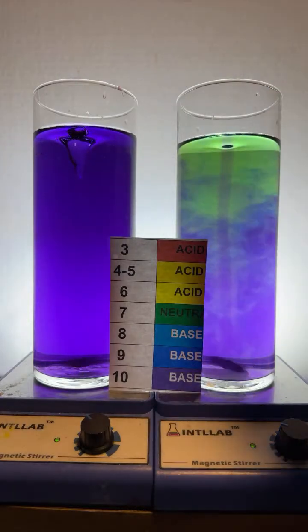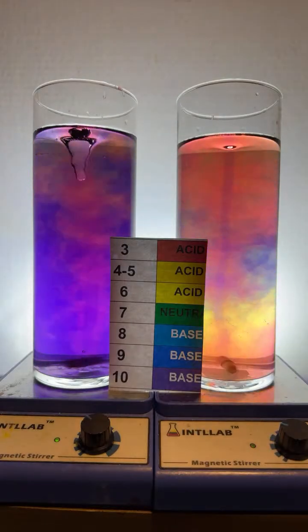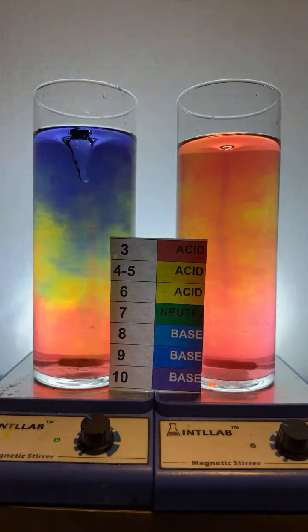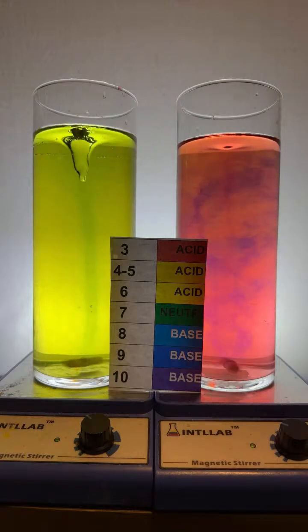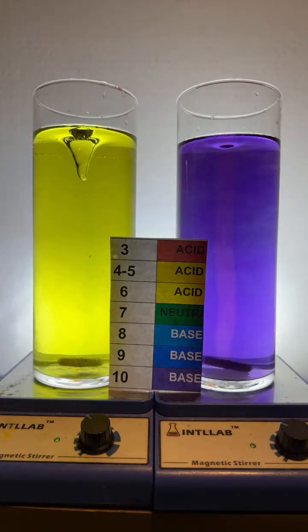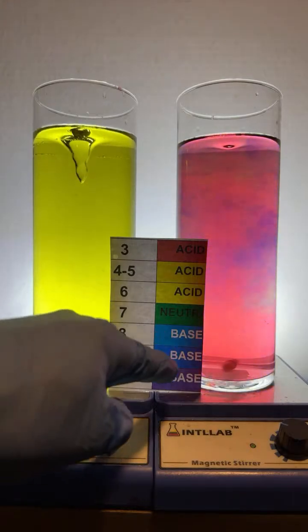Notice I'm adding acid to this flask over here, and I'm going to add acid to this flask over here. And notice what happens to the colors when I add acid. They change, which means the pH is changing. All right? So that's what's going on. I'm going to add a little bit of base over here, 1 drop over there on the right. And you can see that color change from pH 3 to pH 10 with 1 quick drop of base. Now I'll go over here and I'm going to add like 3 drops of acid. And if I add that 3 drops of acid, we have gone from a pH of 10 back down to a pH of 3.